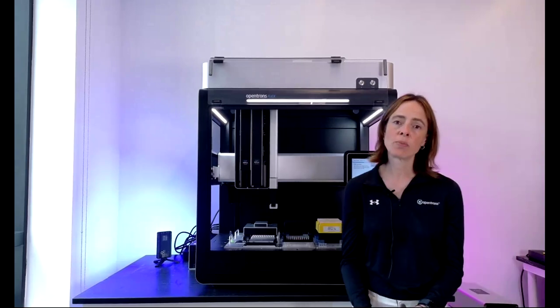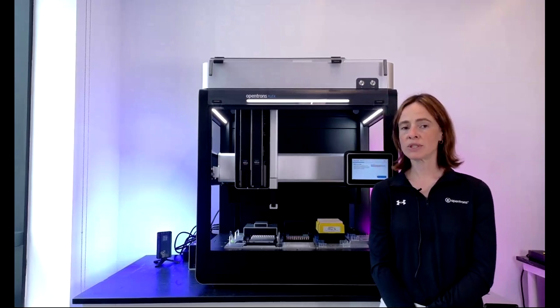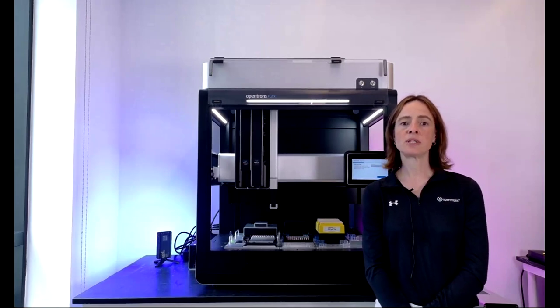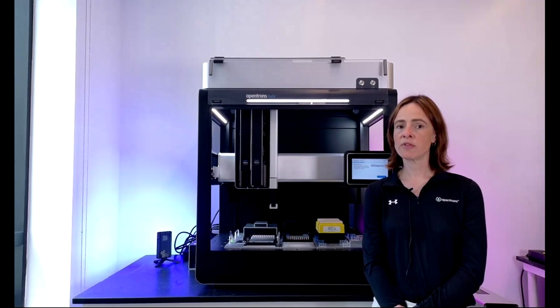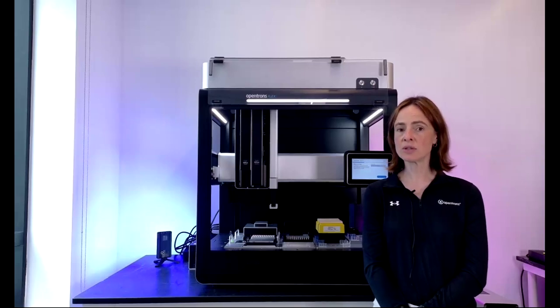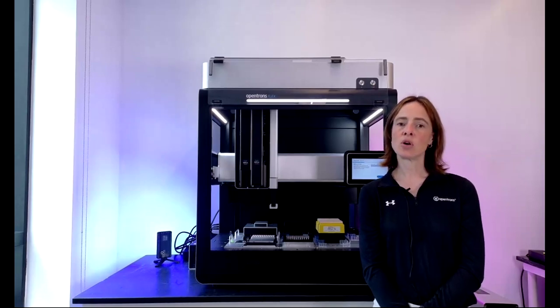And finally, I just wanted to talk about our service offerings. So we offer a white glove approach to service for our users. That includes on-site installation of the robot, training for your team from one of our specialized field application scientists. They also provide you with on-site support, quick turnaround time, ongoing preventative maintenance, and IQ/OQ. So we have both field application scientists to really act as your technical and application automation consultants, as well as field application engineers who are more focused on the ongoing support and PMs for your robot.